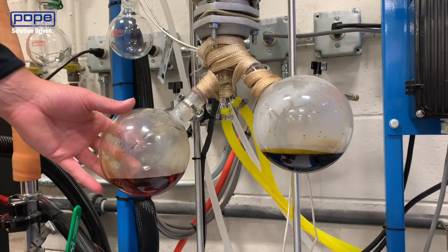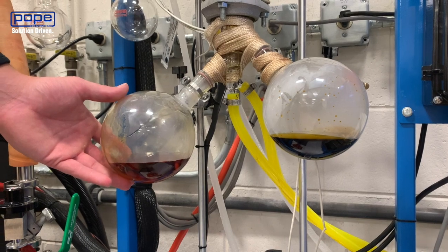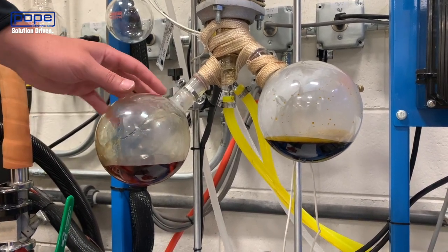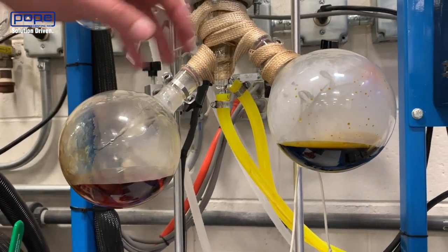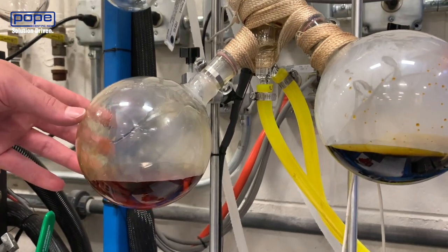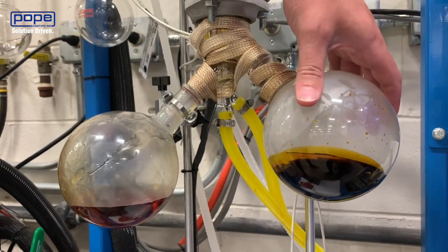On the left here, you have your distillate. When processing cannabinoids, you're looking at anywhere from 60 to 70 percent being in your crude extract, so when you're processing, you want to see relatively close to that ratio. As you can see, I have a little bit more distillate than I do residue coming in. Typically with CBD, you have more of an amber profile than the gold profile you see in the THC cannabinoid. The residue then is going to be a thick, very viscous material.